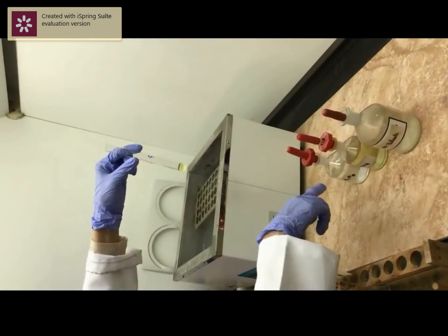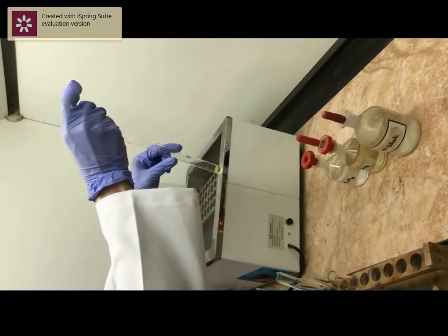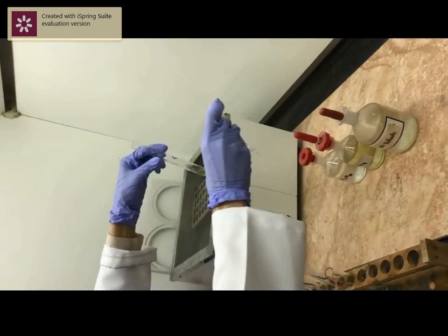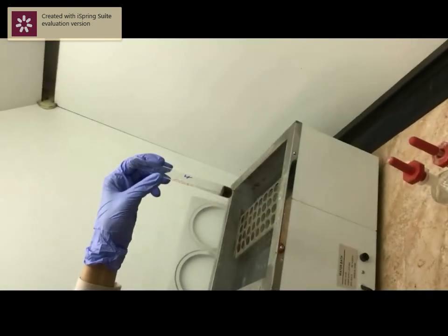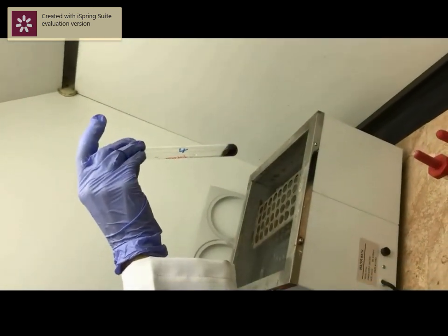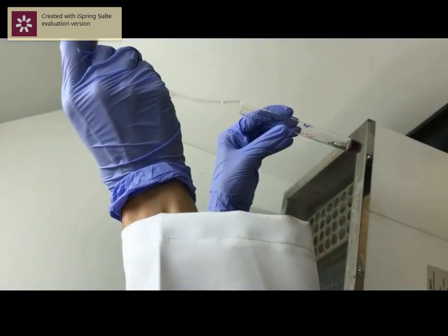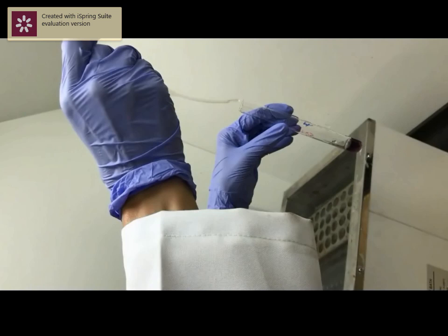Add two drops of hydrogen peroxide, followed by excess sodium hydroxide. Watch the violet color.